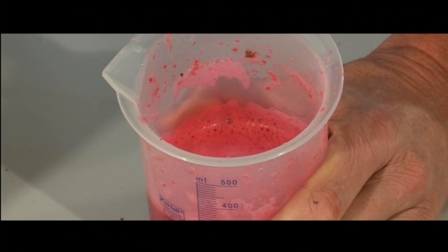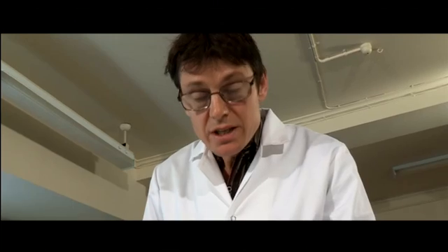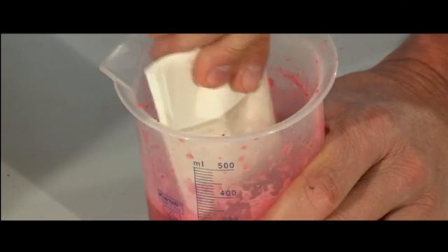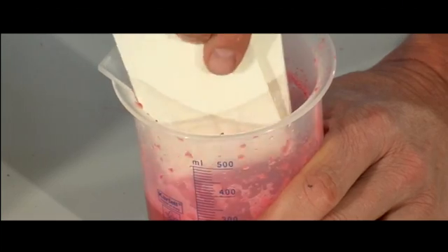What you need to try and avoid is this froth. That's what you get if you swirl it too vigorously. It's easy to get rid of though. All you need to do is get a bit of paper towel, very carefully dab up that froth, and the paper towel will soak it up.